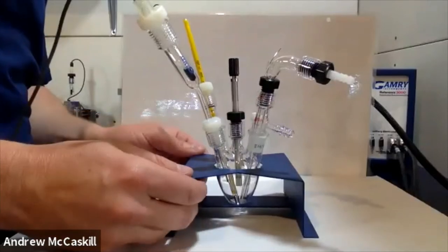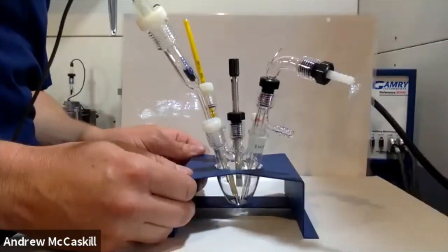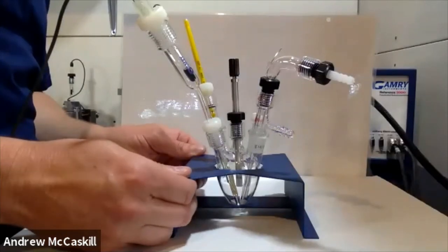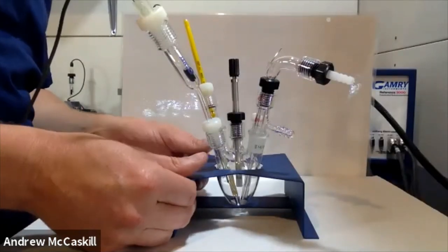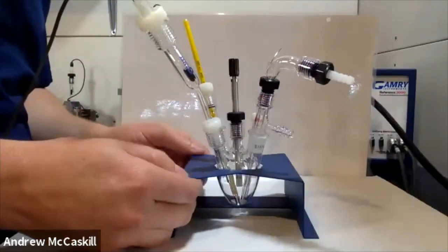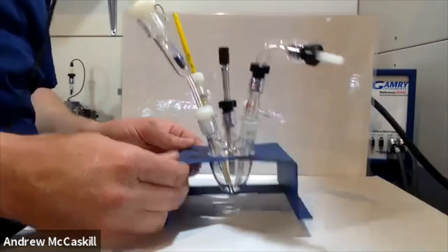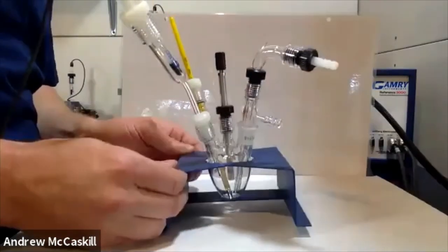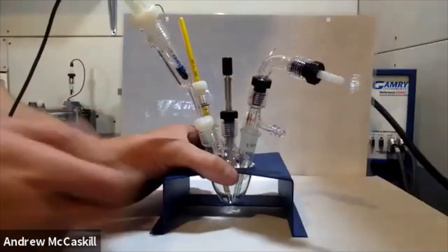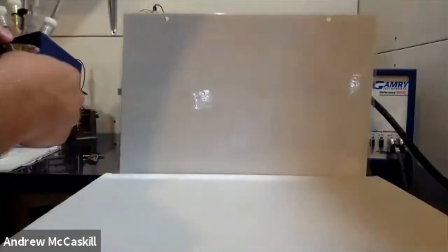This is our very low volume cell. If you're doing novel synthesis with very expensive reagents, this is probably the kind of cell you want to look at. I wouldn't recommend doing that with a screen-printed electrode because the quality isn't there — the volume is very good for those, but if you're using expensive electrolyte make sure you get a quality cell for those small volumes.